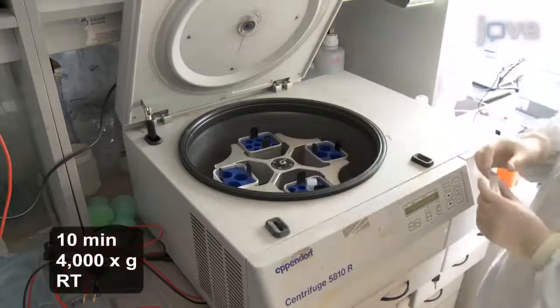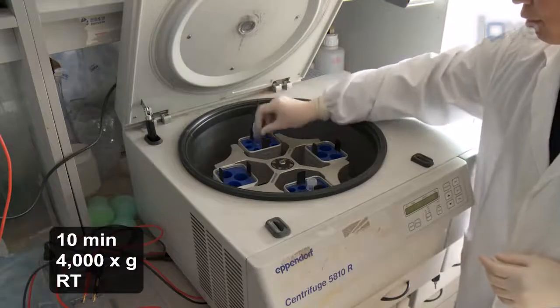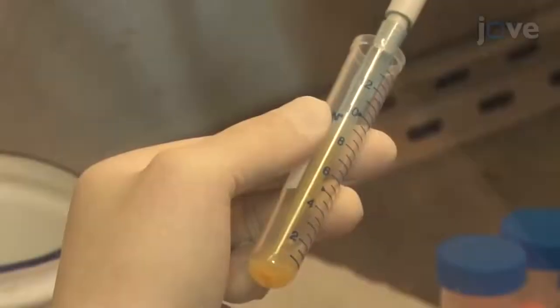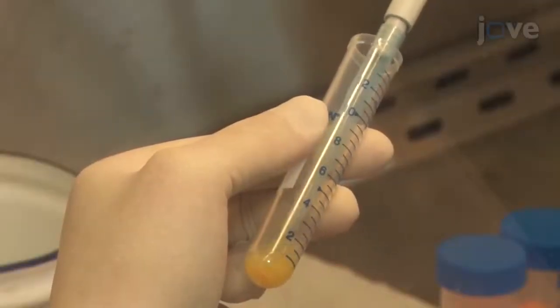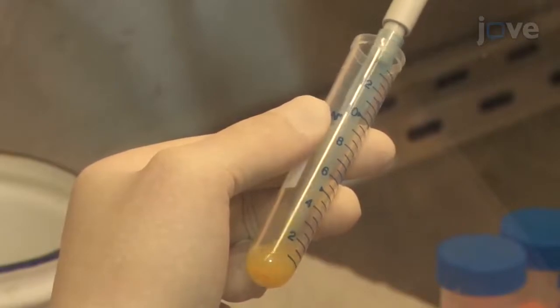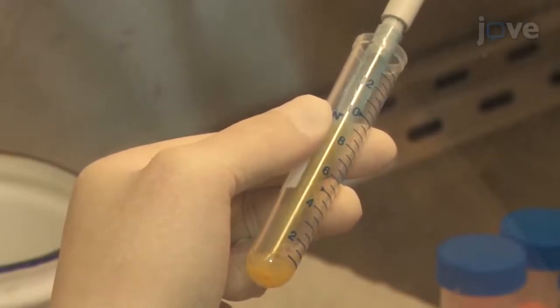When the cultures have reached stationary phase, centrifuge the bacterial cells and re-suspend the pellets in PBS to a 2 x 10 to the 9th colony-forming unit per milliliter concentration.